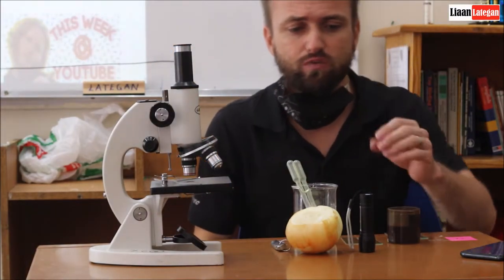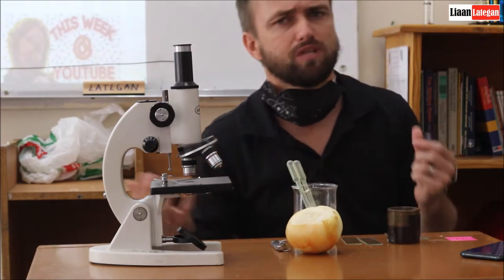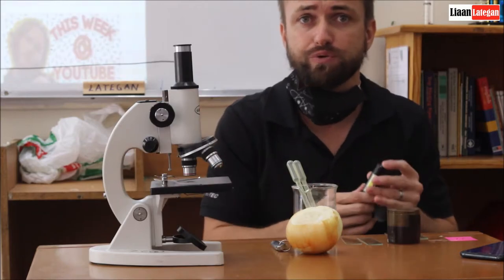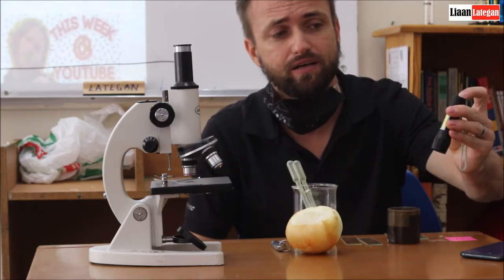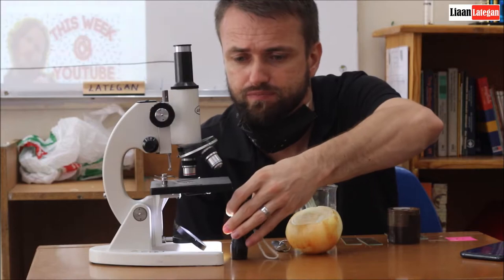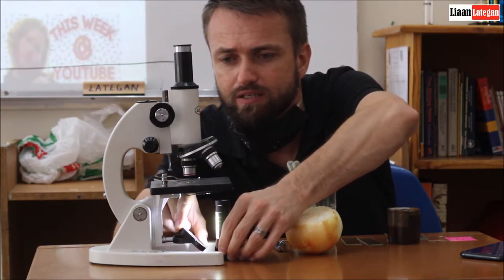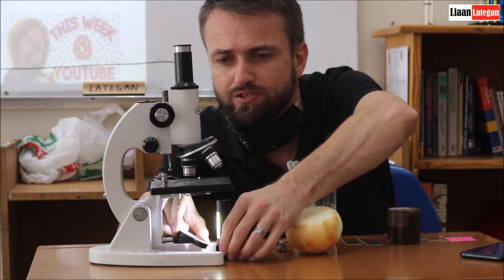Objectives can also be known as lenses. So obviously what we need is light. So light is a bit insufficient today in the classroom. So what I'll do is I'll just add a little bit of light. Make sure that the mirror and the light is working nicely together.